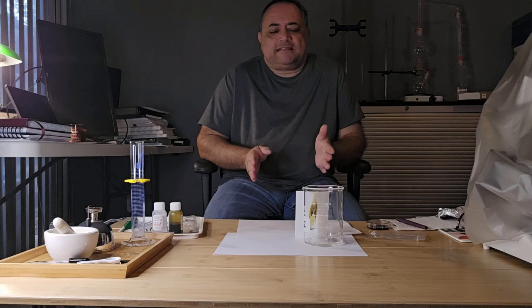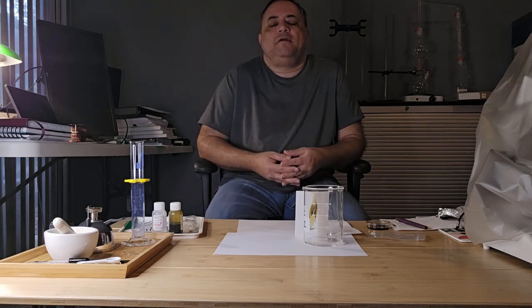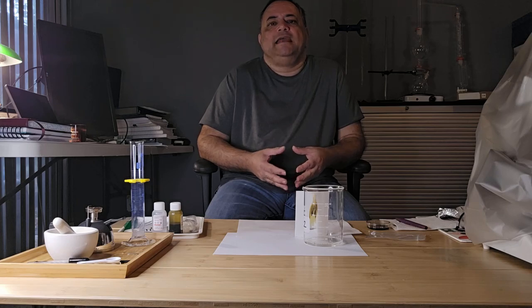This was just to get you started and learn the basics of chromatography. There will be future videos where I'm going to look at the separation of amino acids using thin layer chromatography and identifying the presence of different amino acids in an unknown mixture and comparing it against controls.